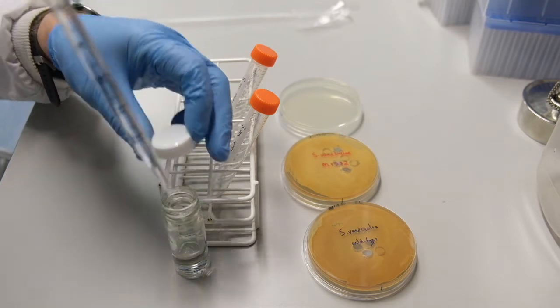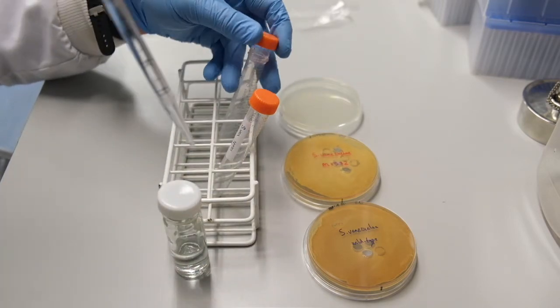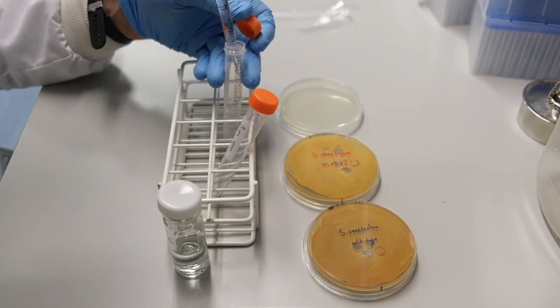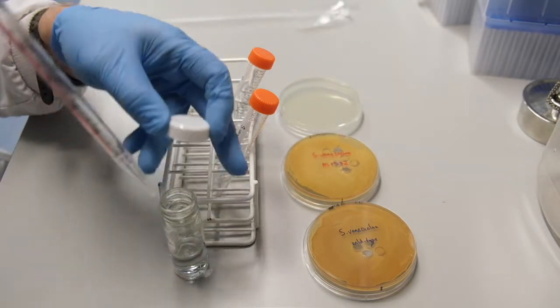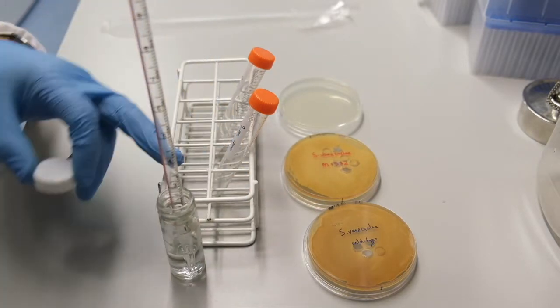These are the same plates we have previously used to cut discs for agar plug diffusion assays. We will collect our spores in 10 milliliters of sterile 20% glycerol.